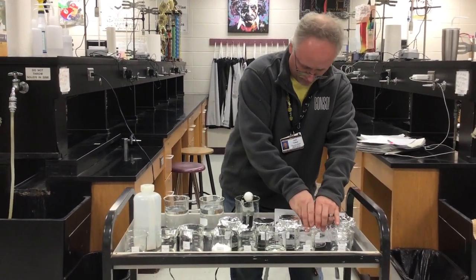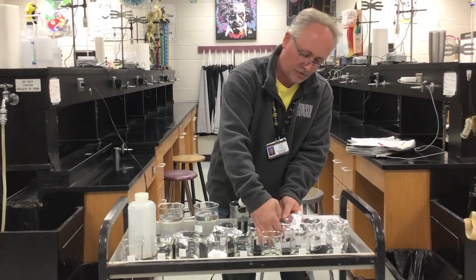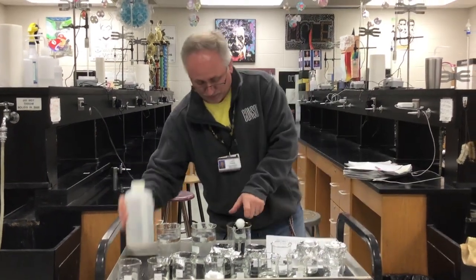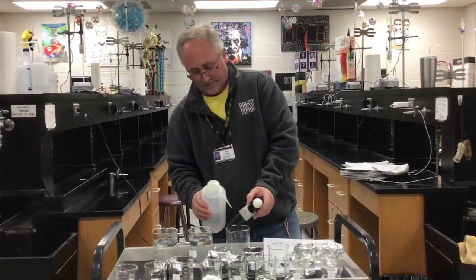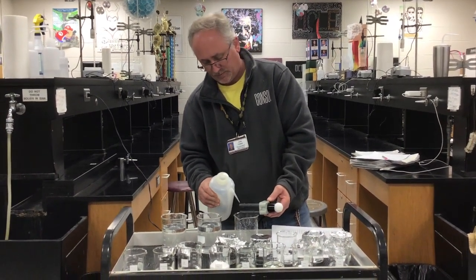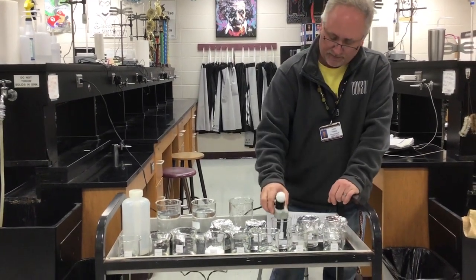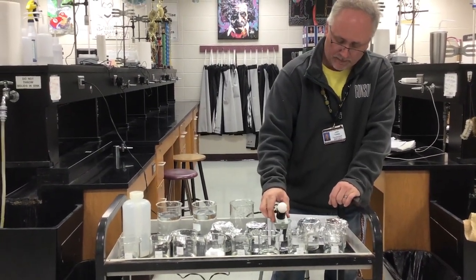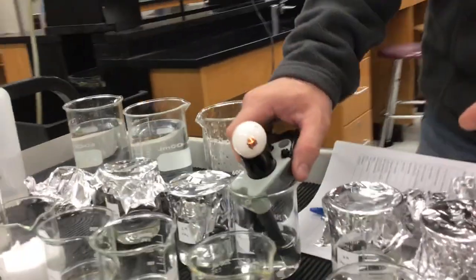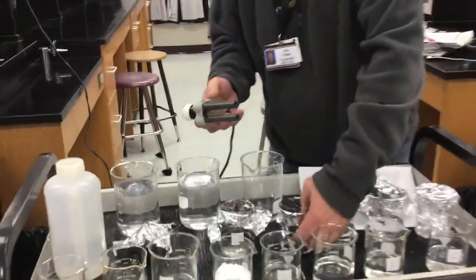After the 6 molar ethanoic acid is 6 molar ammonia. This is 6 molar NH3. This one is a higher concentration than the next one I'm going to do. This one is 6 moles per liter. The one I'll do after this is only 1 mole per liter. We'll see if we notice a difference between the two. It's difficult to see if there is, but this is 6 molar ammonia. Can you see from there? I'm not sure. It's lighting up just a little bit.